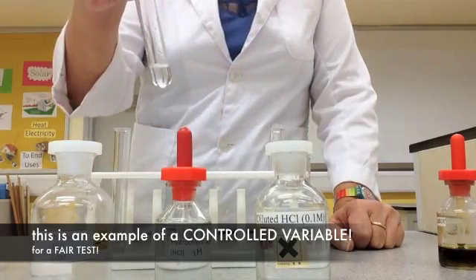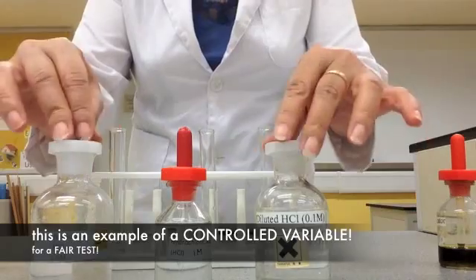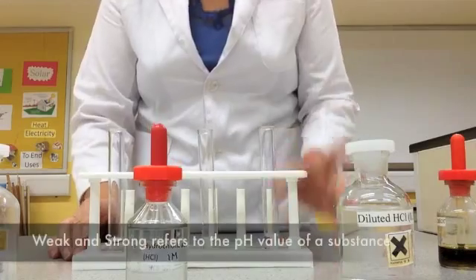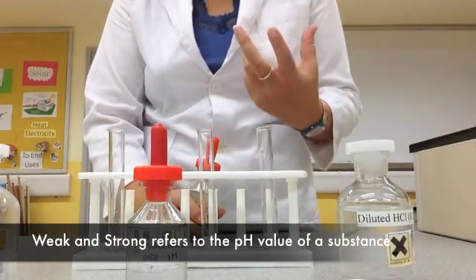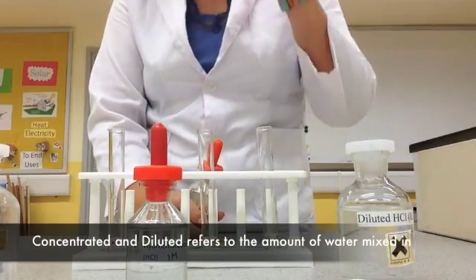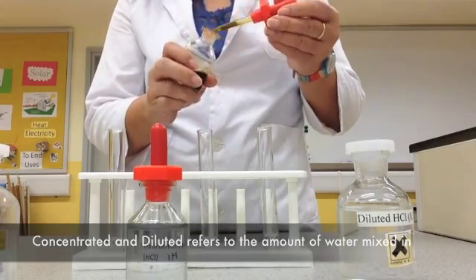So I have some here and some here. Three different concentrations. How do we know that it's the same strength? Remember, weak and strong has something to do with the pH value. Concentrated and diluted has something to do with the amount of water you mixed into the solution.